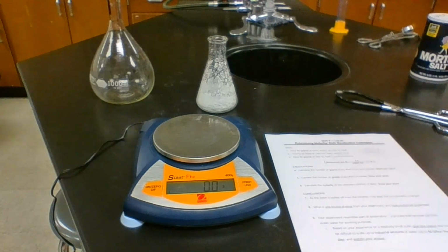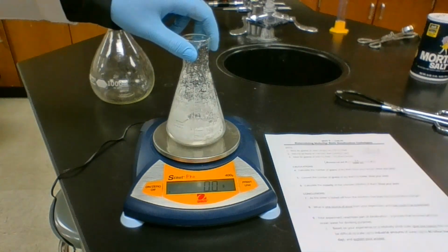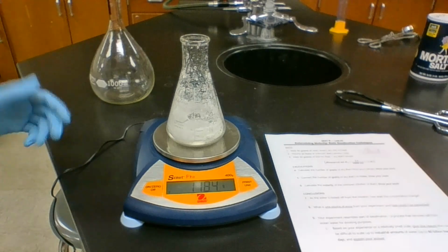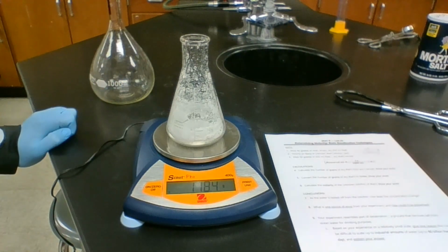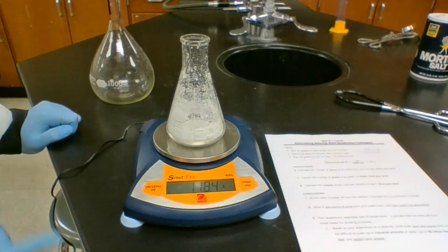Okay, once all of our water is boiled off, we can measure the mass of the flask and the salt together. If we subtract the mass of the flask, we're left with the mass of the salt, the NaCl. Once we've got that mass of salt in grams, we can convert that into moles, which can then be used to calculate the molarity. Moles of NaCl divided by liters of solution that we started with, 47.1 milliliters converted into liters, can get us our molarity.